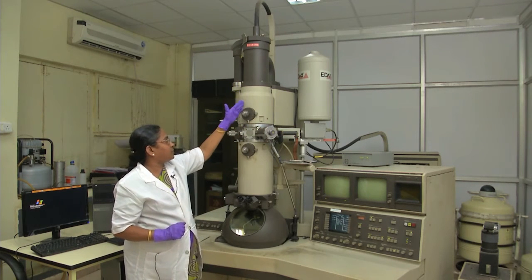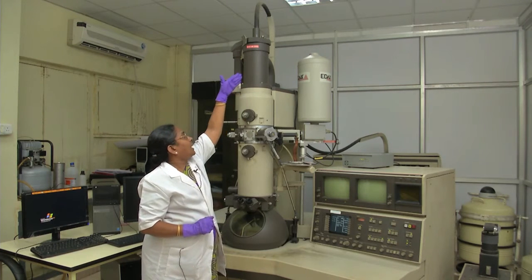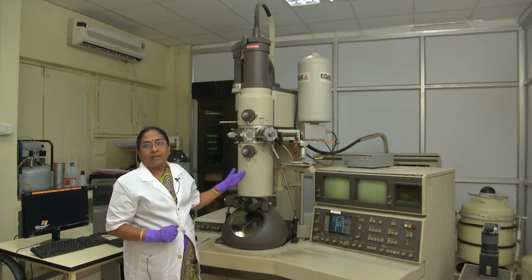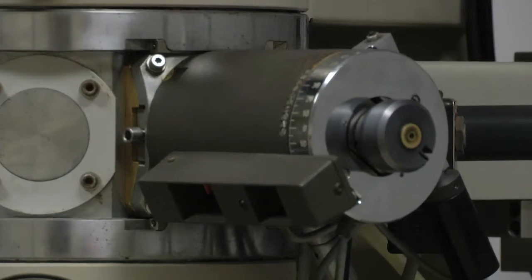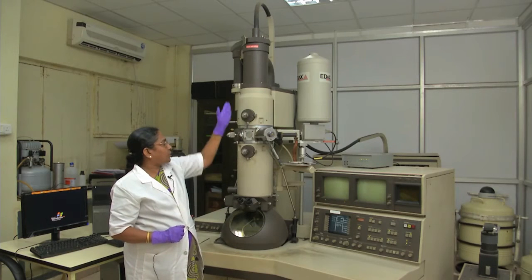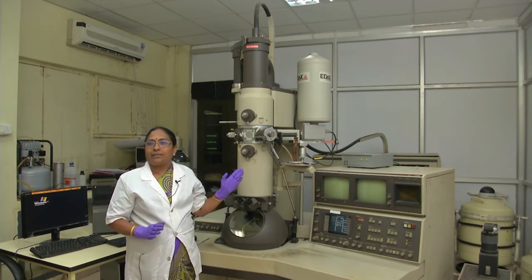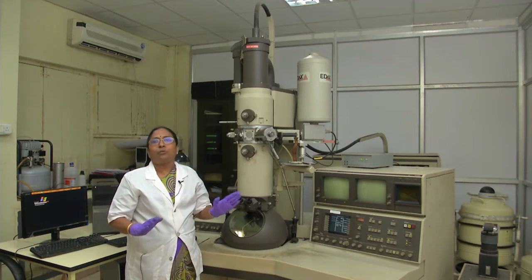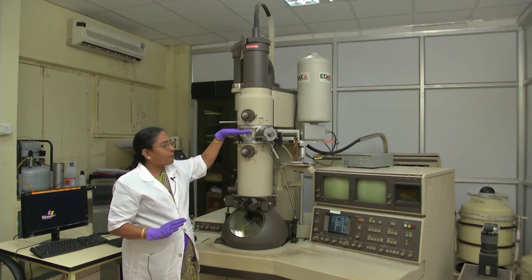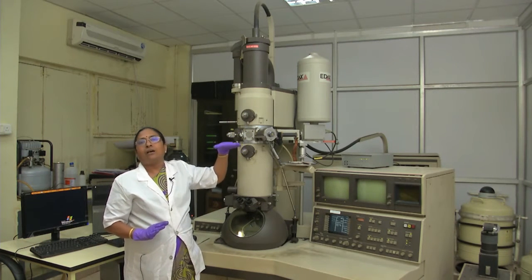This is a very important point in the transmission electron microscope: the electron beam is generated by heating the filament, then bunches of electrons come out, pass through the lenses and apertures, and then must pass through the specimen. This portion is the specimen inserting position, called the goniometer. Because electrons pass through the specimen, the specimen thickness is very, very important — you must use an ultra-thin specimen. Your specimen should not exceed 100 to 150 nanometer thickness; otherwise the electrons will stop. You must thin the specimen to 100–150 nm by different methods.